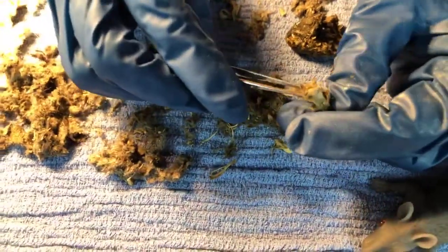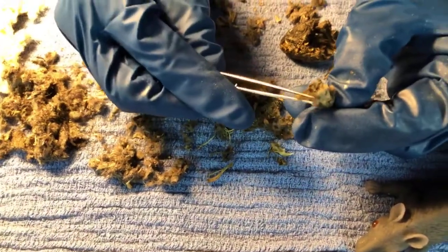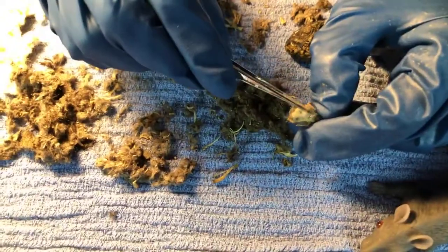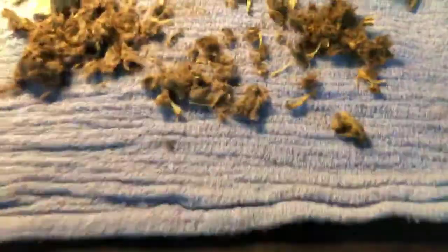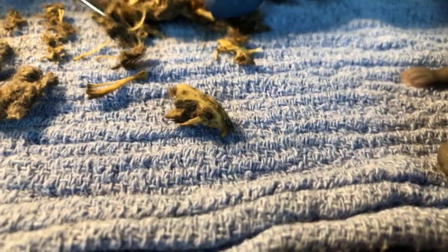You see a lot about rodenticides, and really that's one of the niches that especially barn owls provide for us, is they provide rodent control. And look, we asked for a skull and we got one. Let's see if we can zoom in on that little guy here. Yeah, isn't that cool? So interesting.